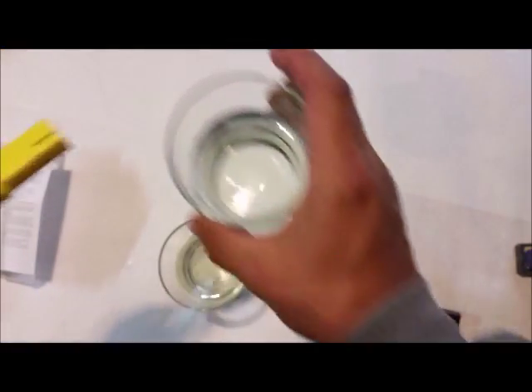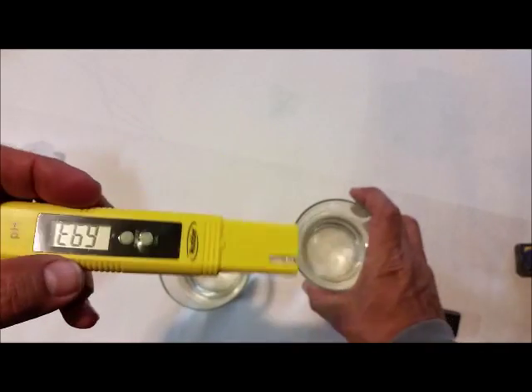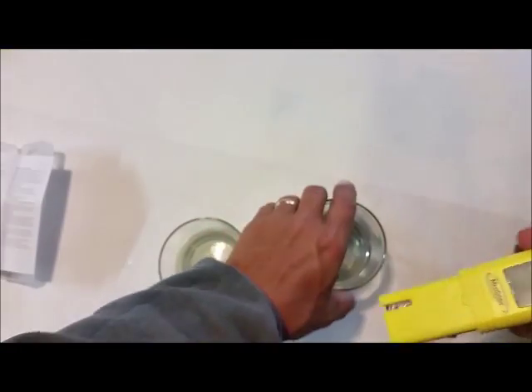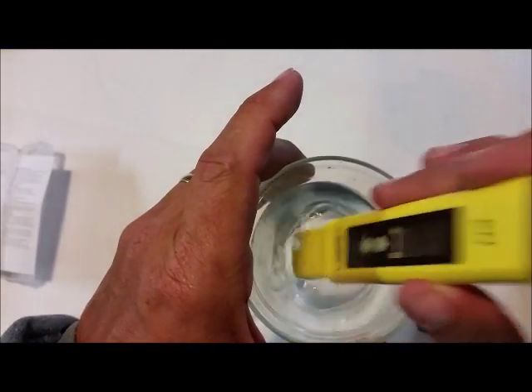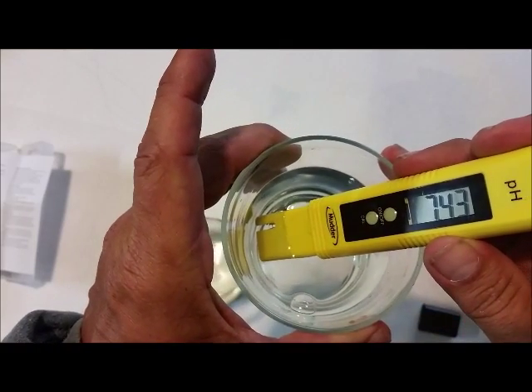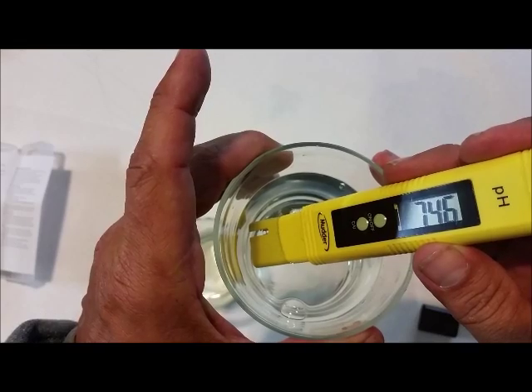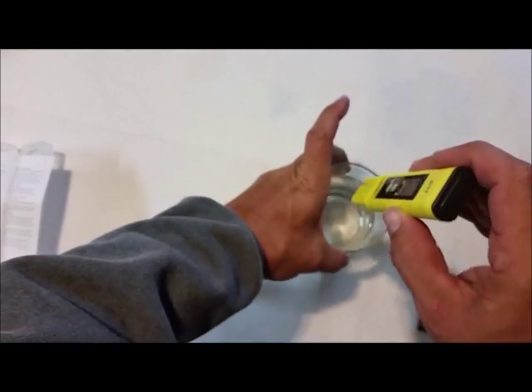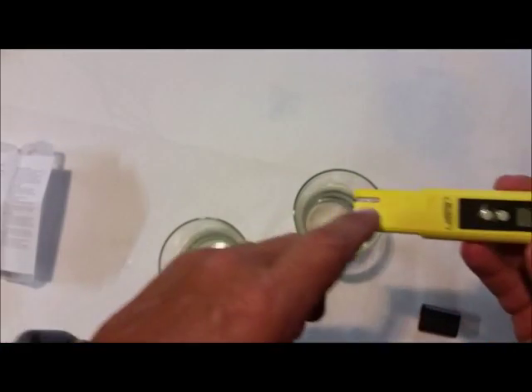And just getting that vinegar back in this water by rinsing it off. It'll probably drop this down from where it was. I'm sitting here splashing it and rinsing it off, but it'll probably take this down from where it was. Yeah, it'll drop it. And I rinse this off in distilled water, the tip.